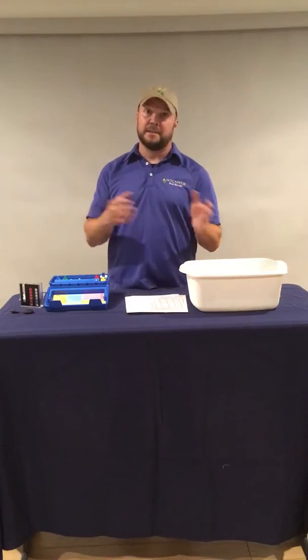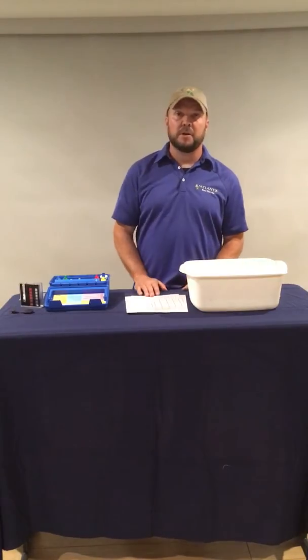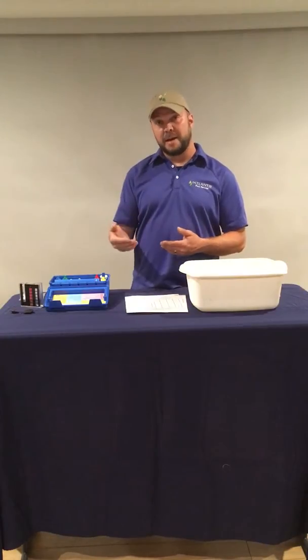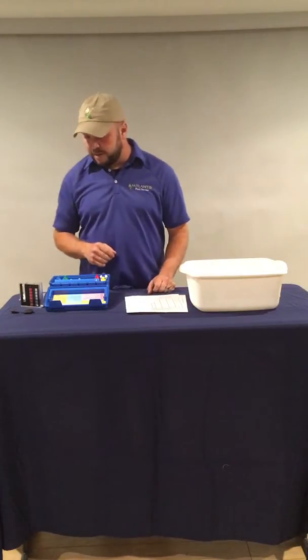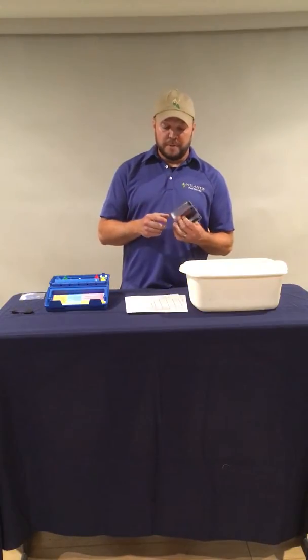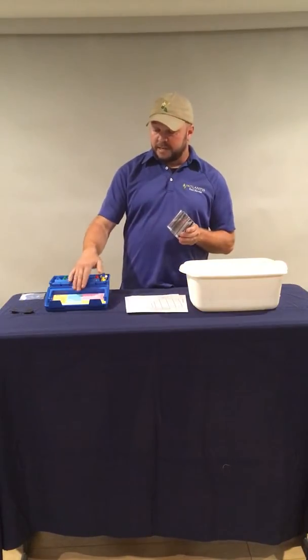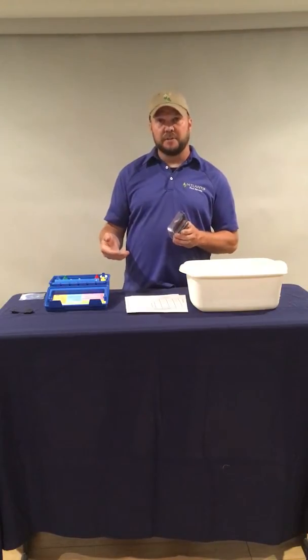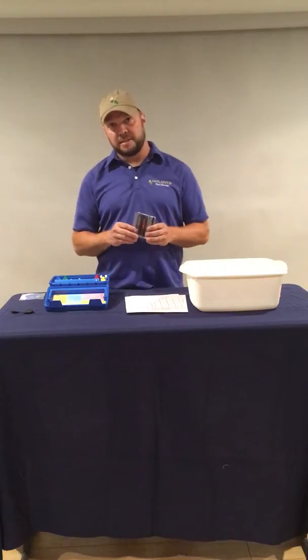It's just a way to get to the combined chlorine. So the two things that are required for state testing are free chlorine and combined chlorine, which we're going to be testing for here today. So we're going to take our comparator tube, and on this test kit, the instructions are right on there, but sometimes it's very difficult to understand what they're saying. So that's why we're doing this demonstration.